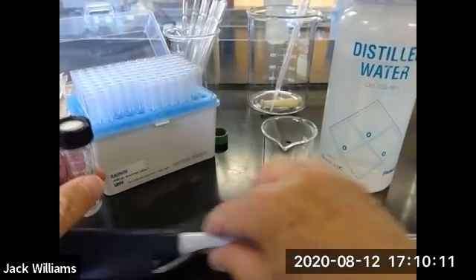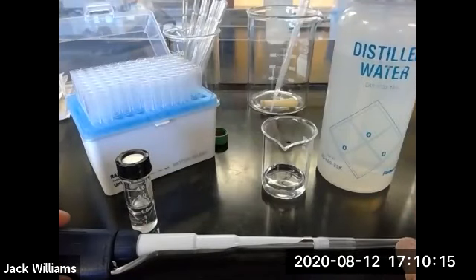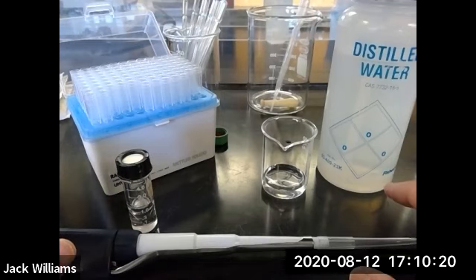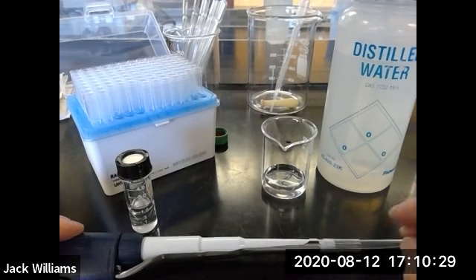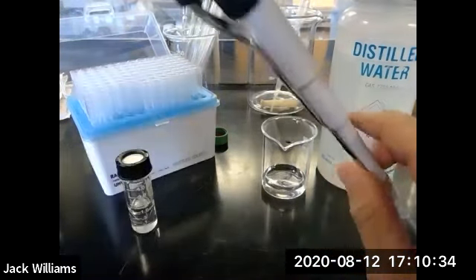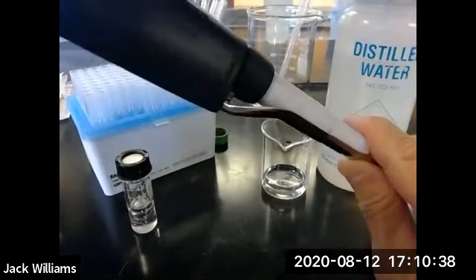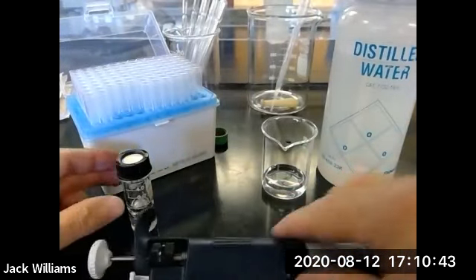You know, it's not something you really want to do because this will contaminate the bench top. And when you work in the biology lab or the biochemistry lab, then you've got a problem with contaminating your sample rather than the sample contaminating you. So you've got to watch out for other things. You can actually buy a stand that'll hold your pipette, but they're $80. Can you believe that? For a hunk of plastic. So I'm still working on trying to get them for the lab. But in the meantime, we'll place this on the table.